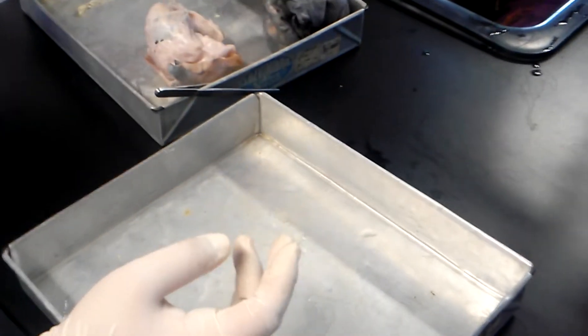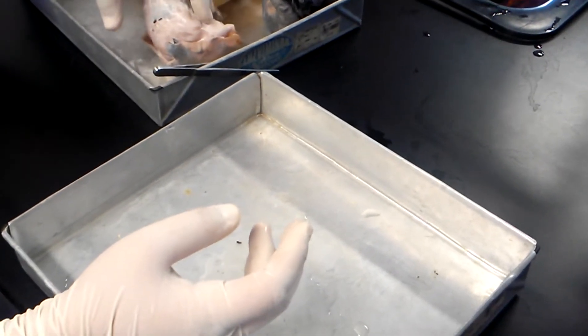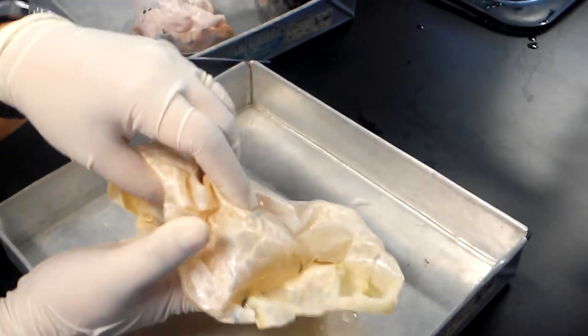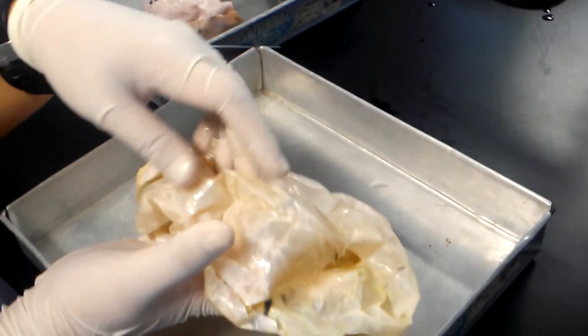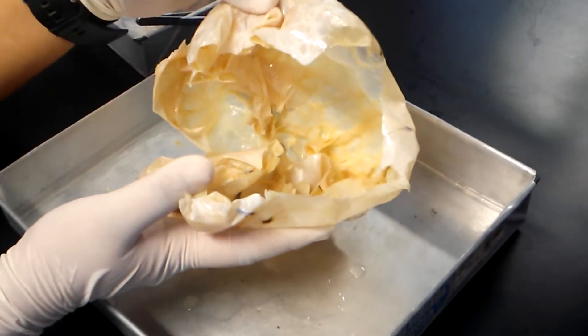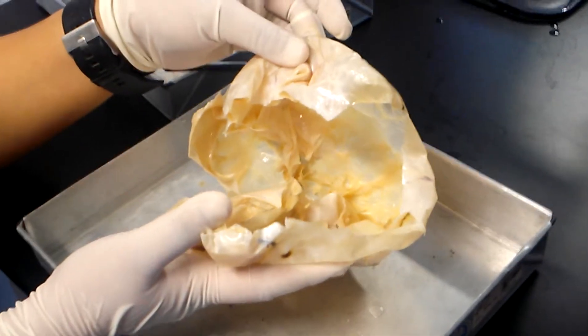Usually we receive this intact. This is intact, and when you open it, usually it contains a lot of fluid. It can reach up to 2 liters sometimes.